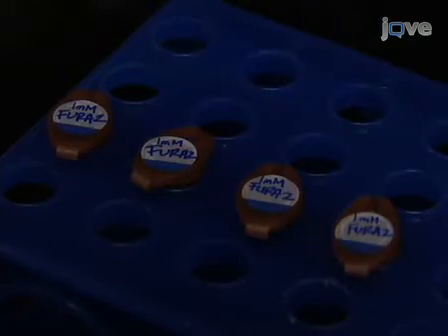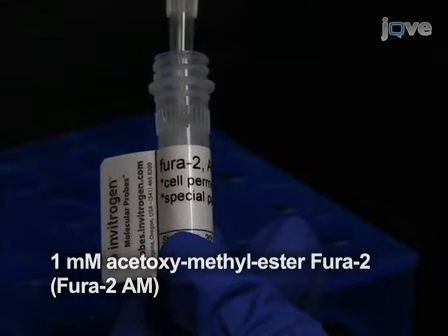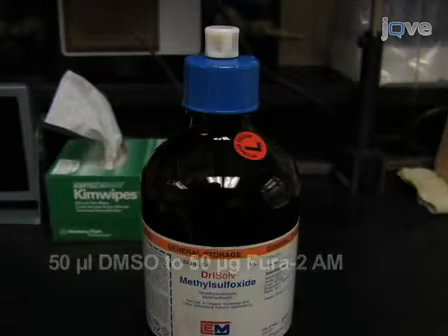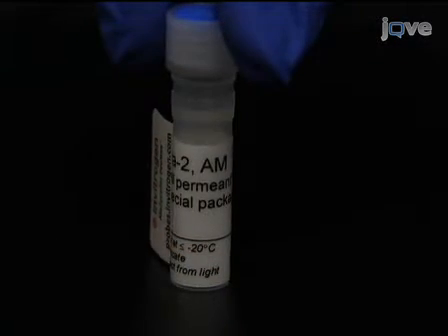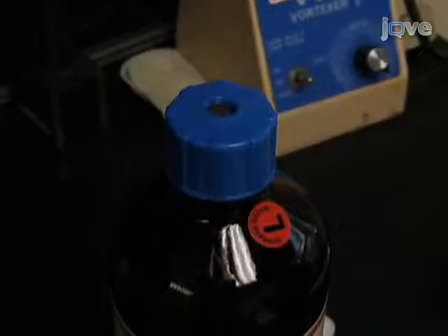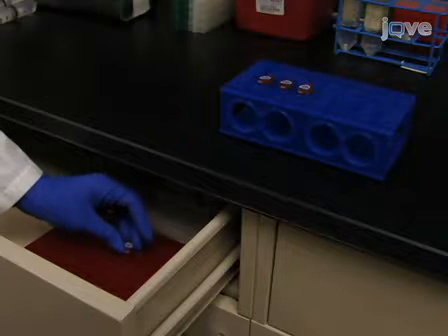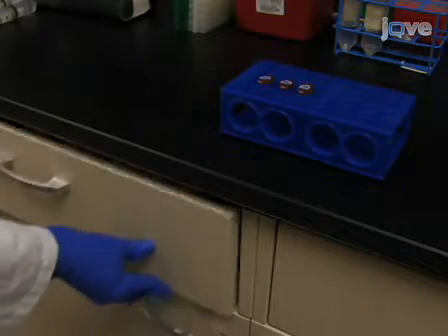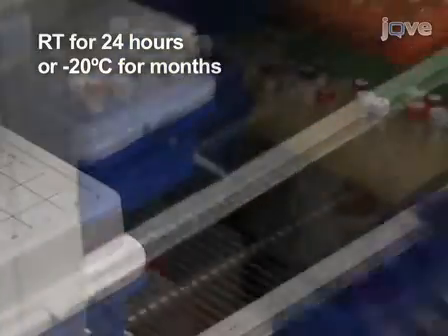To begin the cell loading step, prepare a 1mM stock of Fura-2-AM by adding 50 microliters of DMSO to a 50 microgram vial of Fura-2-AM. It is important to use dry DMSO packed under nitrogen, and it is necessary to remove the DMSO with a needle by puncturing the septum to prevent hydration. Keep the Fura-2-AM solution in a dark, dry place. Fura-2-AM in DMSO is stable at room temperature for 24 hours and at -20 degrees for several months.